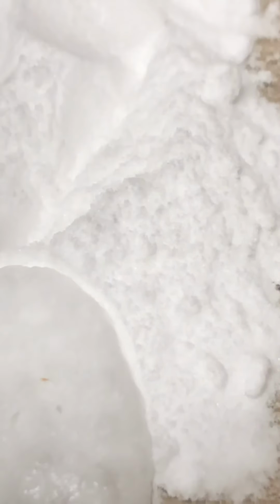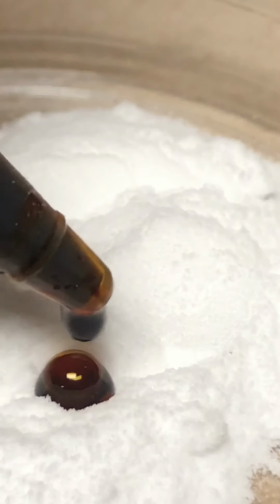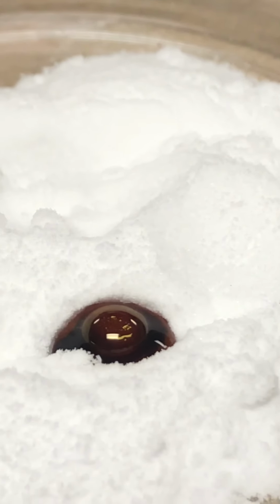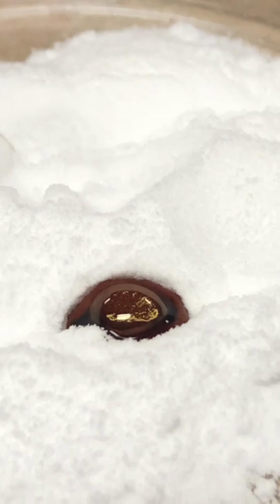Okay, and now the iodine. So just rub the lid off. See, it'll stain your hands. I have my hands all stained. Okay, so make your observations about what happened when I added the iodine.